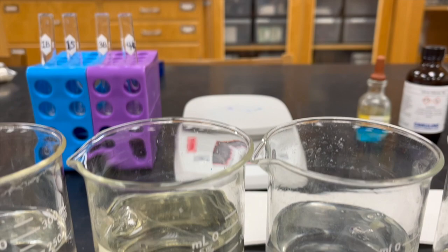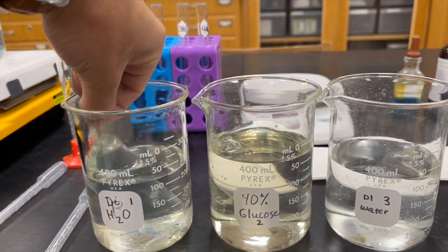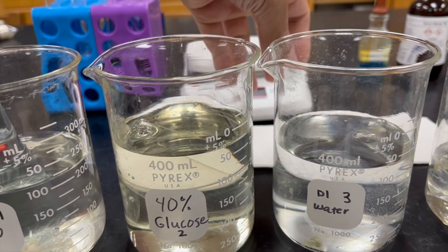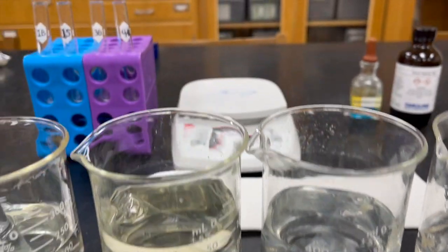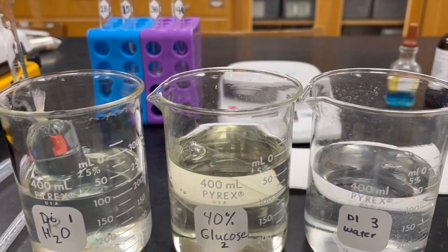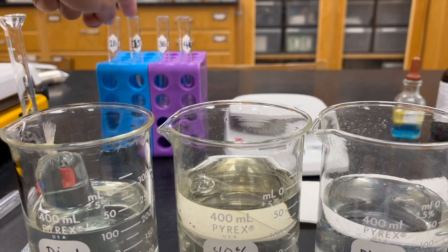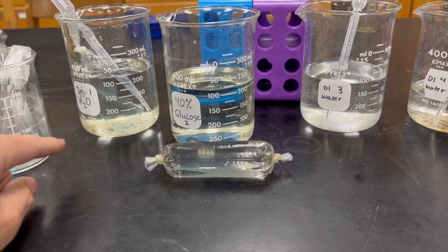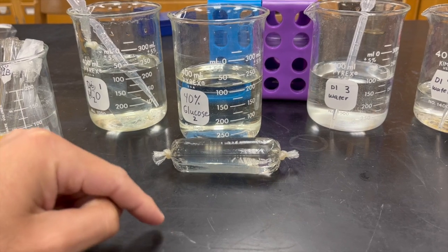At the very beginning, you're going to take each of these dialysis bags, put them out on the paper towels, and dry them. After you dry them, you'll weigh them. After you weigh them, that's when you can start doing the pipetting and you can cut the 1S sack to put that into this test tube. Write the results down, but make sure that they weigh the bags before and after and record those results.